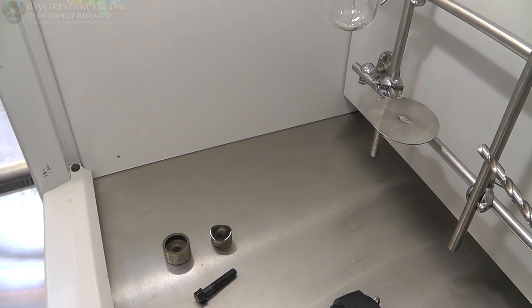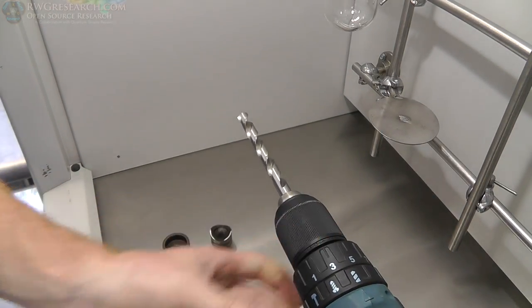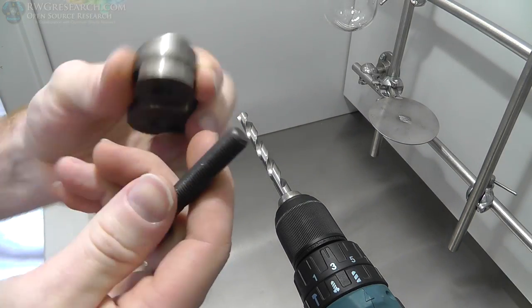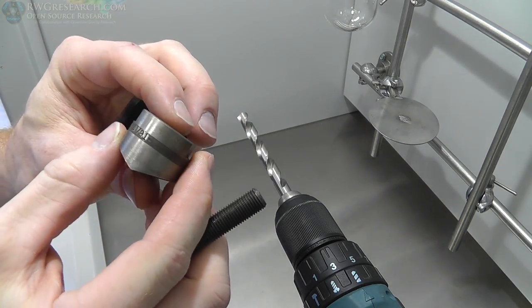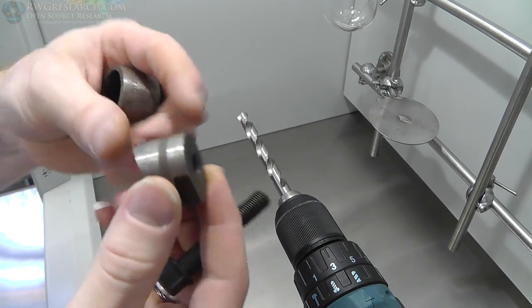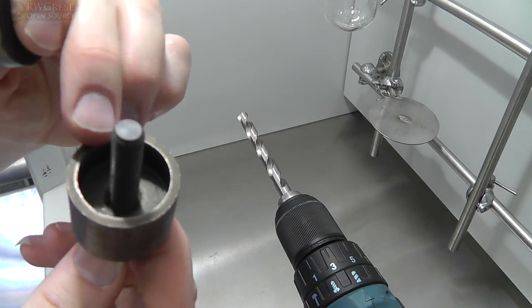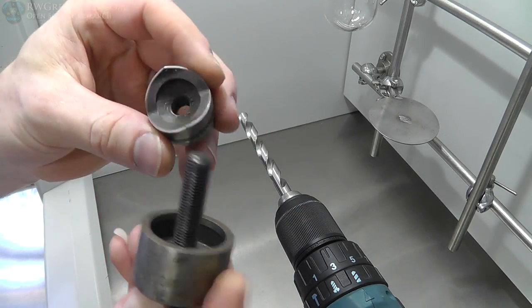So what I'm going to actually be doing is drilling a hole with a drill bit and then using what they call a knockout punch to actually put the hole in there. Some of you have never seen such a thing, so I thought I would demonstrate how this works. This is the part that has the cutting edge on it. I think this is the die part. This is the punch part.